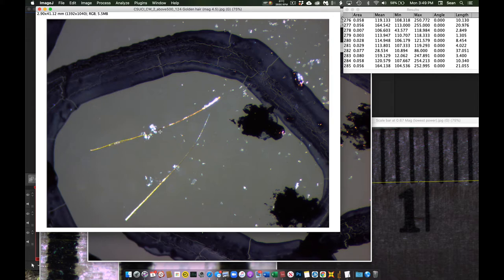But when I measure them, this one comes out to be 10 millimeters. But this one, which is almost the same exact length, just really quickly, comes out to be about twice that. And there's no way this is twice the length of that. The raw measurements appear to be much closer, but somehow the calibration is getting weird and converting it to different lengths.